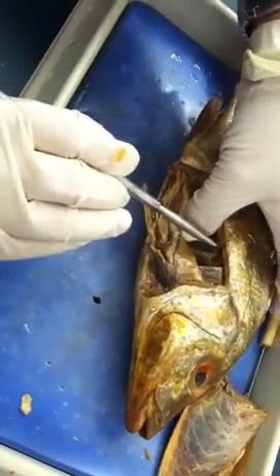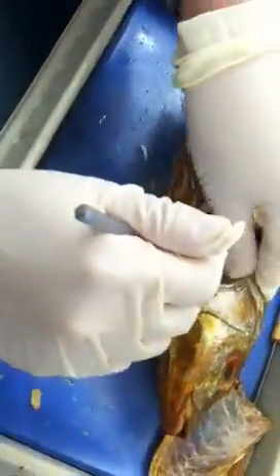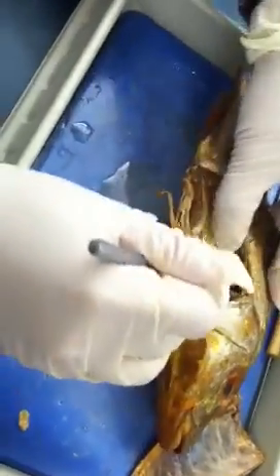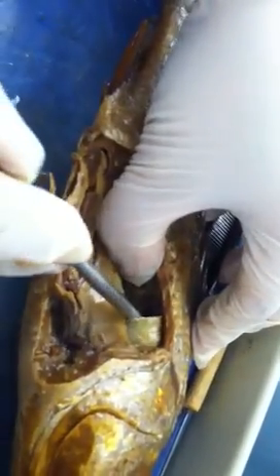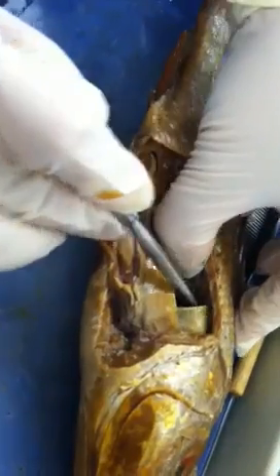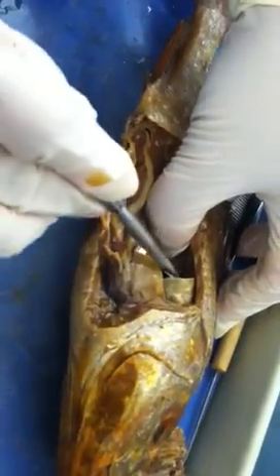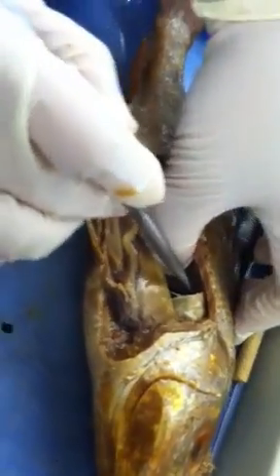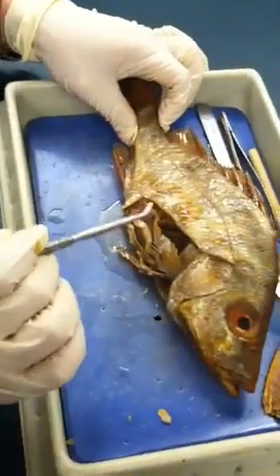And you will see on the back of the swim bladder, if you see a black organ, then that will be the kidney. You will see along the spine a black organ on top of the spine — if a pin is placed right there and you're asked about it, that will be kidney. So the swim bladder will literally be broken, and if a pin is placed on the back, that's asking about kidney.